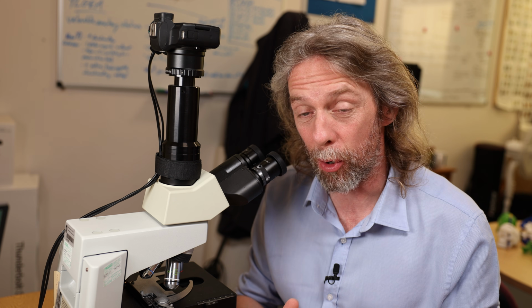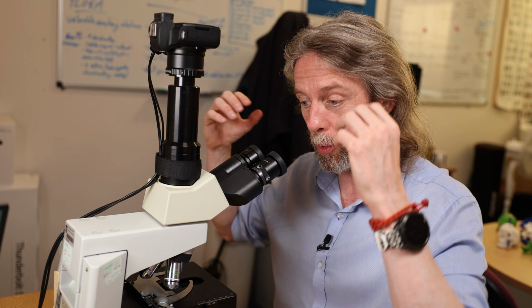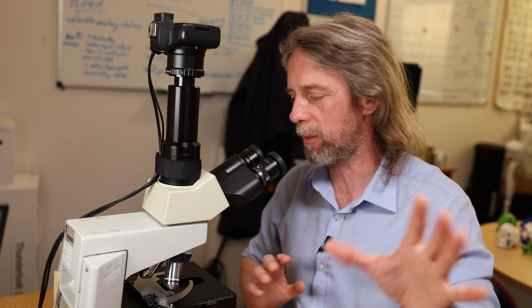I've got a couple of very old slides to look at. We'll look for neurons, and then we'll look at the supporting cells. There aren't very many. We're going to look for oligodendrocytes, astrocytes, microglia. There aren't that many. And again, it's going to be a slow visual look, see what we see, work our way around. You'll see it's fine. Hopefully this won't be too long.